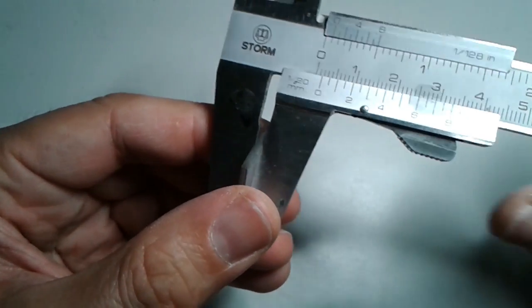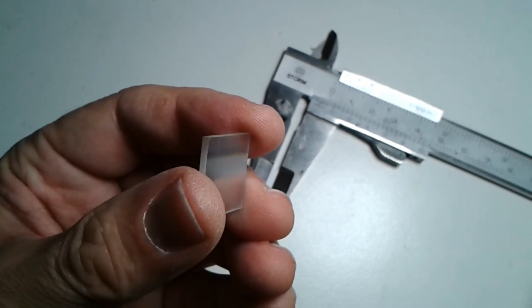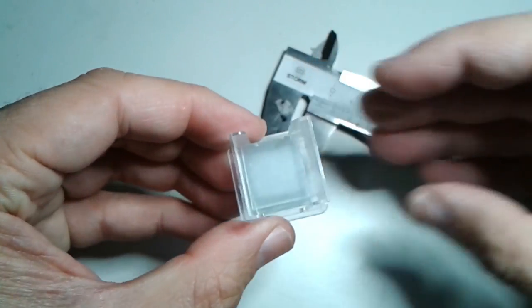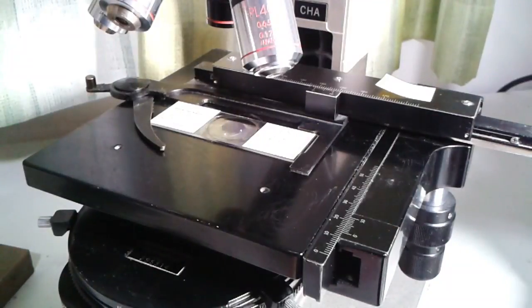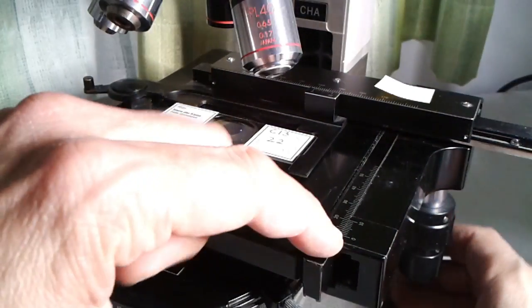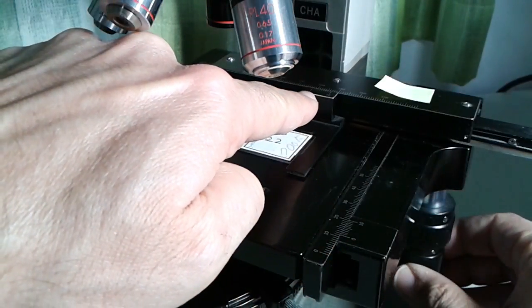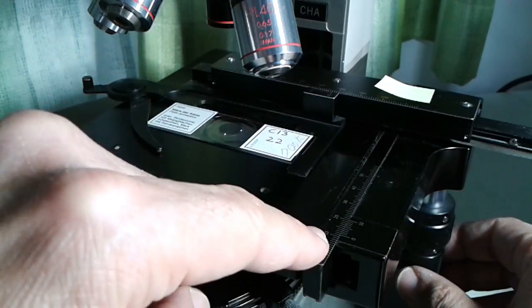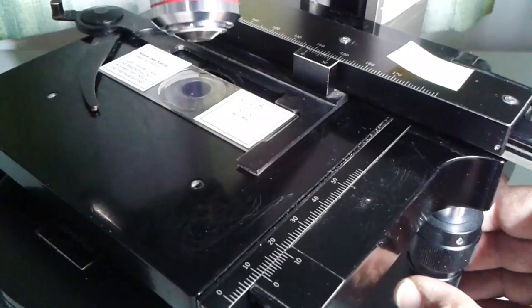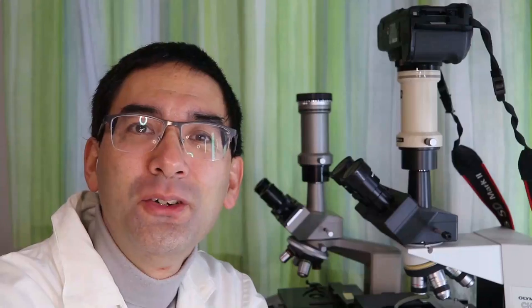So this is here to show you that the principle is the same here as well. Of course you want to replace all back again into your little plastic container. So this is basically what I wanted to show you and you also want to write down of course in permanent slides the interesting objects that you find. For temporary slides of course it doesn't make sense to write down the values because you're not going to keep the slide anyway and also because the objects always change.